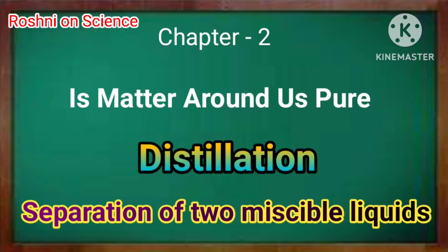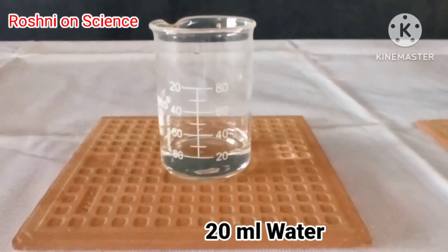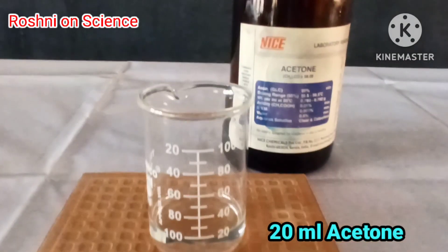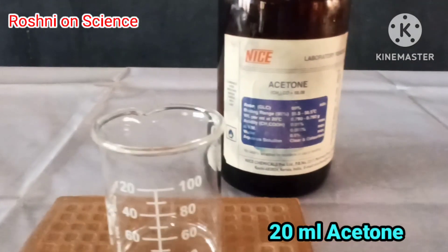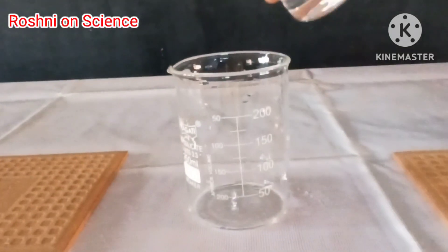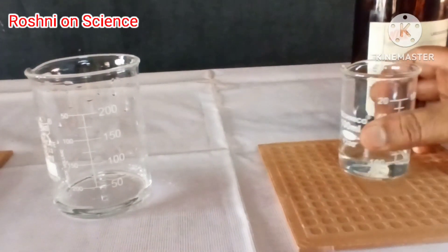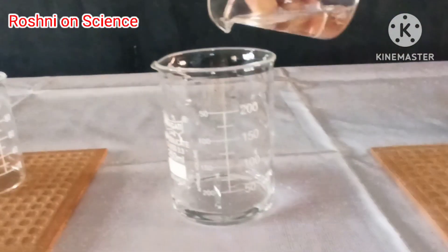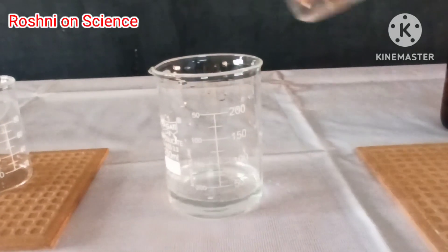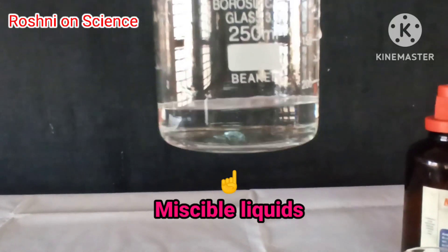Distillation: separation of two miscible liquids. Take 20 ml of water and 20 ml of acetone in a beaker. Mix both the liquids in the beaker. Now we have a two miscible liquids mixture.